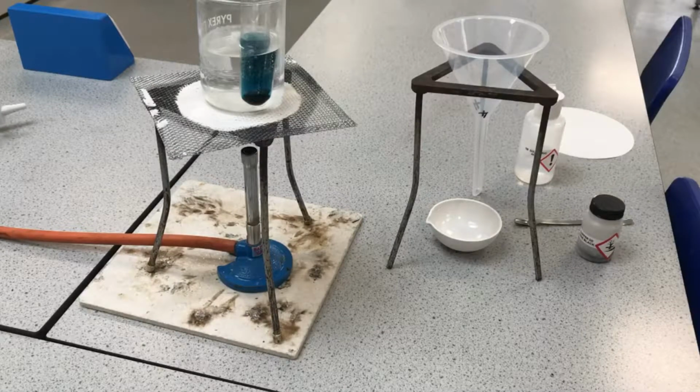When I was talking about limiting reactants earlier, because we have added excess copper oxide, it has made the sulfuric acid in this reaction the limiting reactant. A reaction stops when one of the reactants has been used up, and in this case all of the sulfuric acid has now reacted, so the reaction has stopped. I know that because I've left it for a long time, and it's the unreacted copper oxide that's left, and we're going to remove that now, okay?